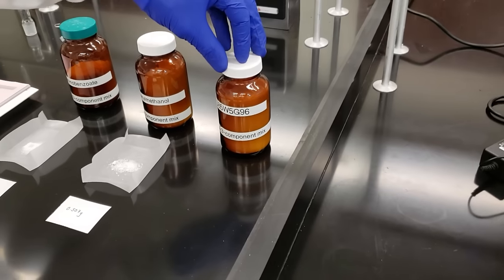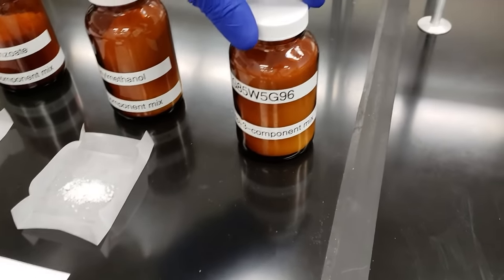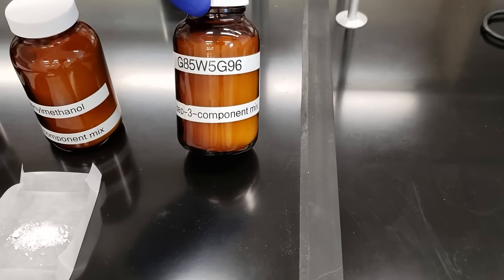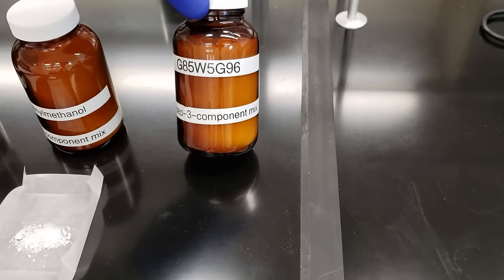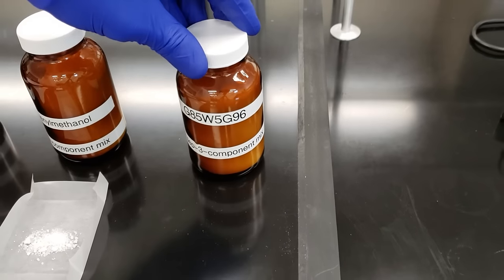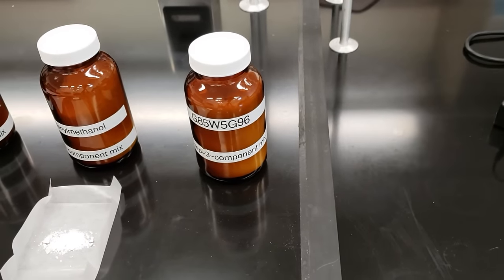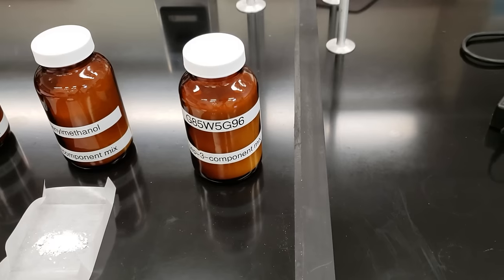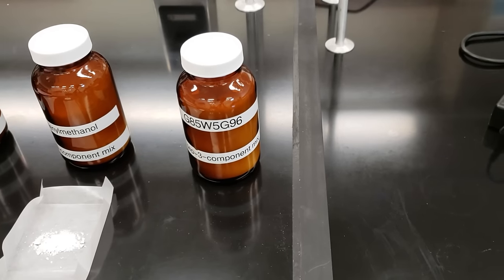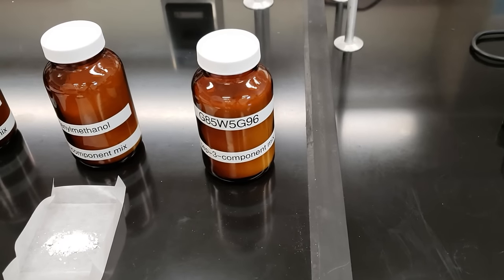And then for our acidic component, we've got three possible unknowns. The unknown that we've chosen is G85, W5, G96. These unknowns are benzoic acid derivatives. We're going to have to identify the specific derivative once we go through and do our analysis at the end of our experiment.